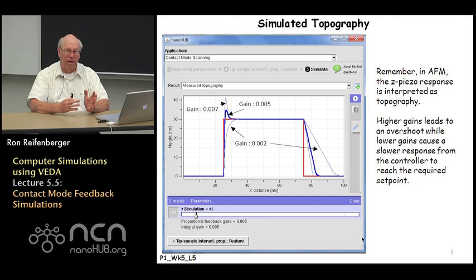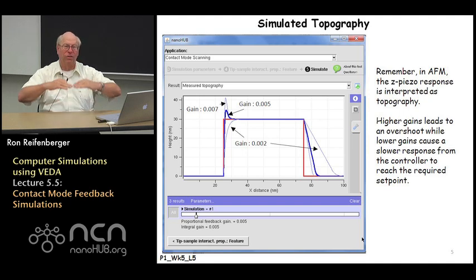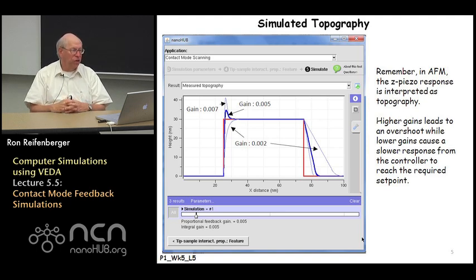I plot out the response of the Z piezo as the tip encounters this step-like feature. The geometry of the step-like feature is plotted in red in this slide, and the various responses of the Z piezo as the tip scans over the sample are plotted in blue. You can see that when the gain is set too low, the tip responds too slowly to the sharp step, and then when the tip loses contact with that sharp step, there's a parachuting effect. The tip drifts down to the flat substrate. It requires a certain length of time for that to occur.